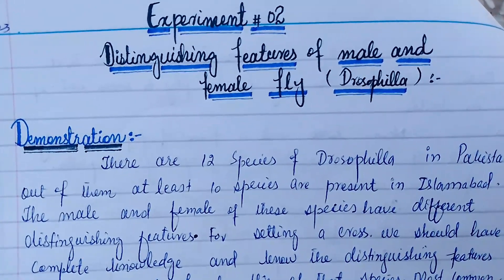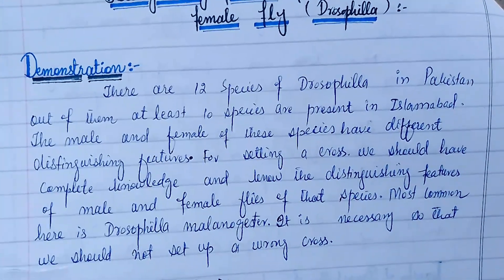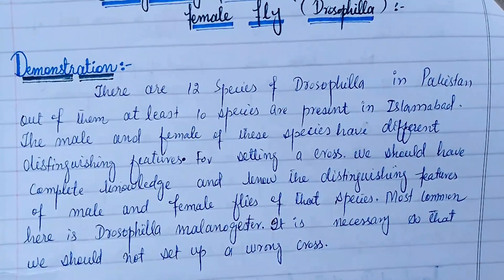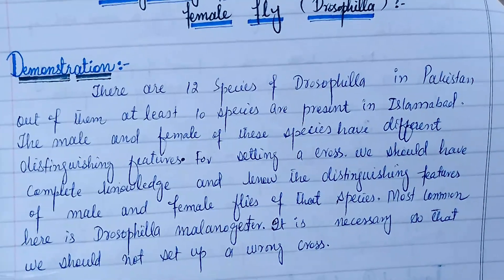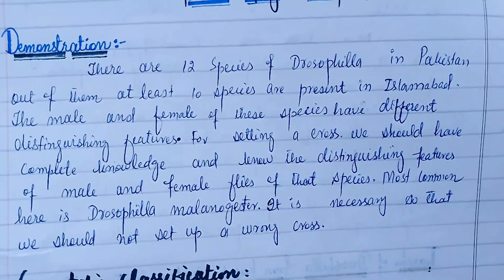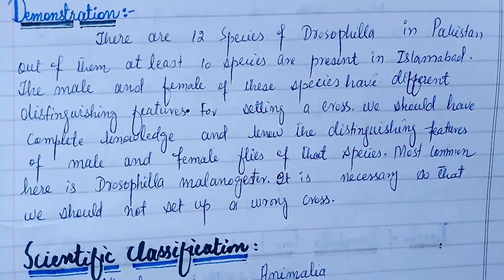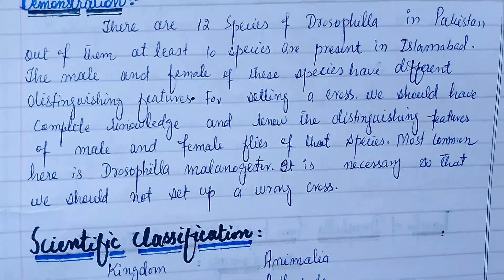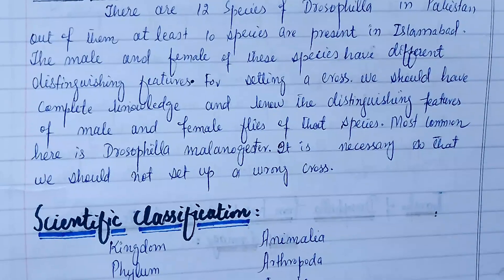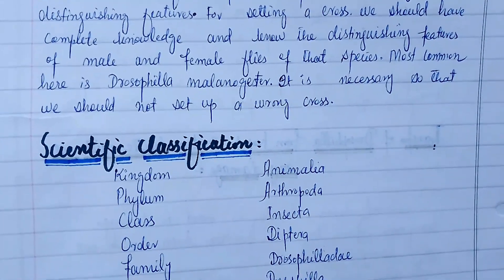We will study the distinguishing features of male and female Drosophila, or fruit fly. There are 12 species of Drosophila in Pakistan, out of which at least 10 species are present in Islamabad. The male and female of these species have different distinguishing features for mating. We should have complete knowledge of the distinguishing features of male and female flies of that species. The most common species here is Drosophila melanogaster. It is necessary that we should not set up a wrong cross.